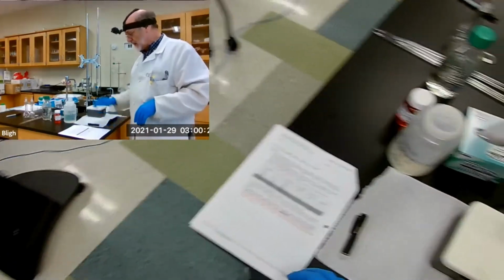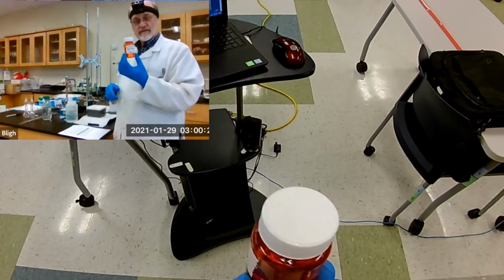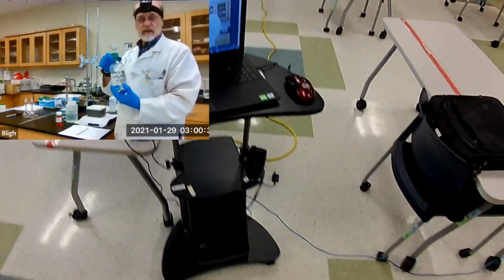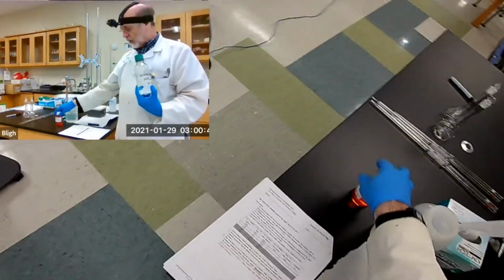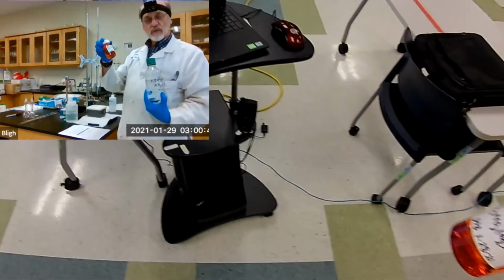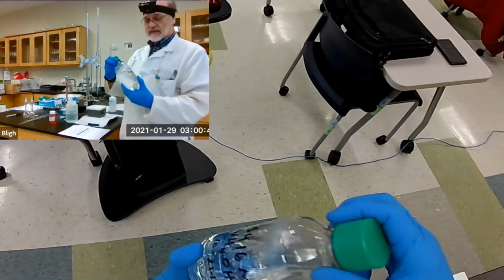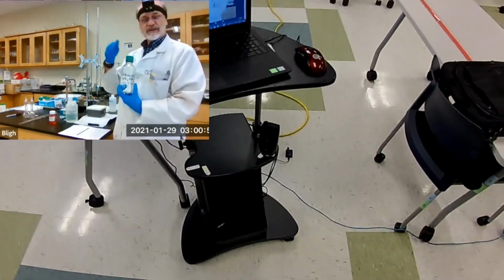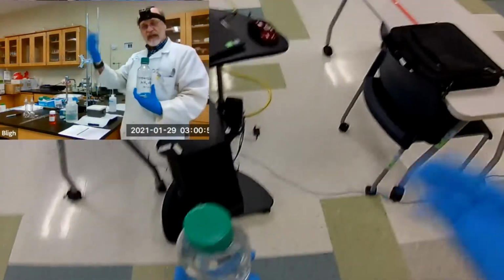So the first solution, we need a 0.1 molar silver nitrate solution, and I just prepared that fresh this morning. We also need a 1 molar ammonia solution, and the exact concentration needs to be known. 0.1000 molar silver nitrate is here. And then this one was determined to be 1.0416 molar. So it's just a little over, but you need that exact value. And I've written it on the board, so you'll catch it in the video.